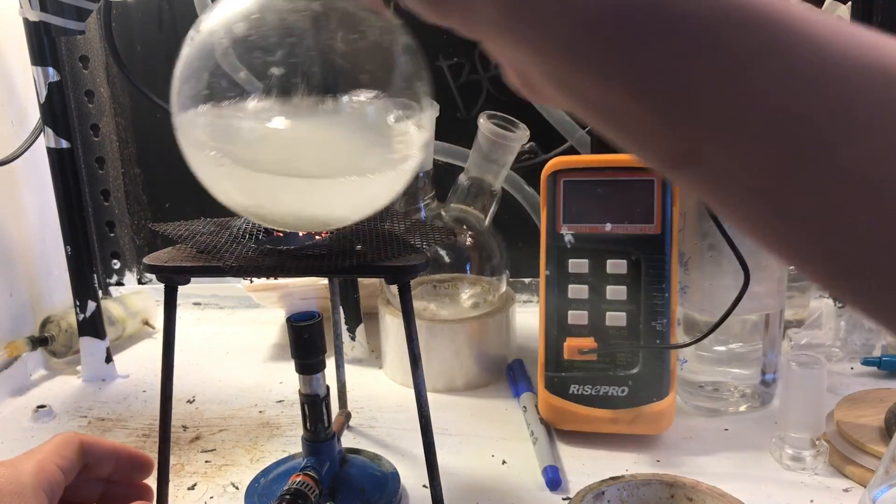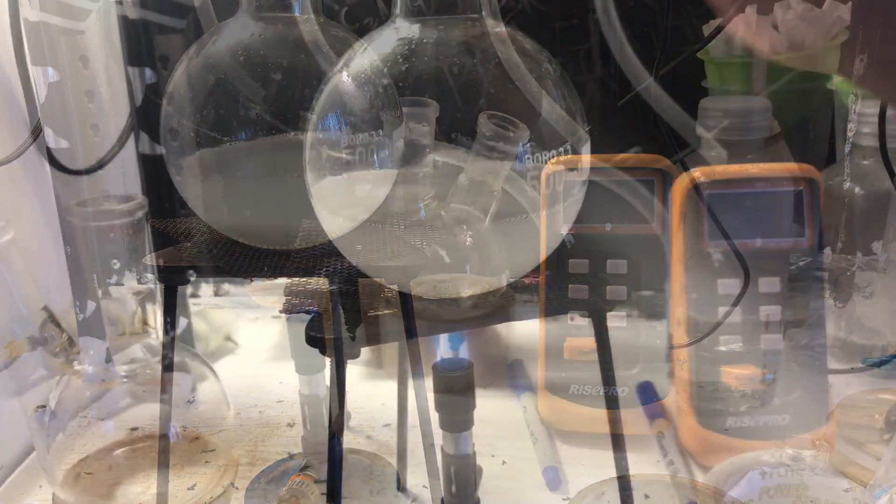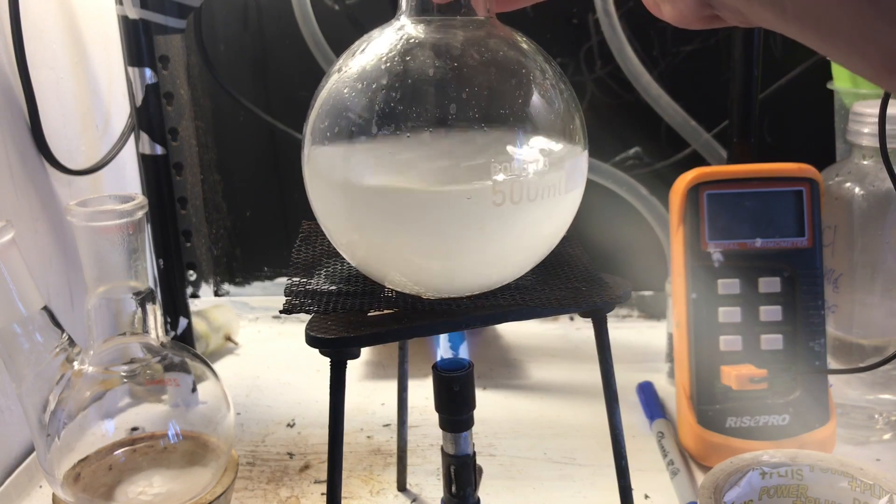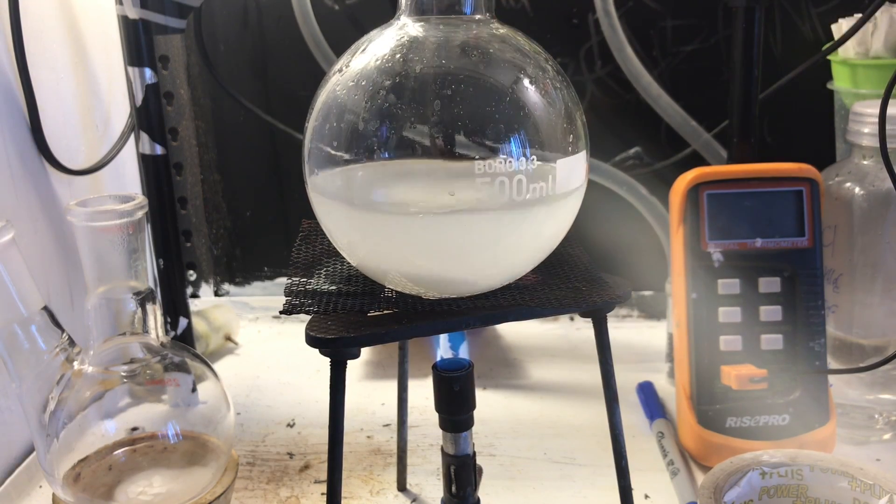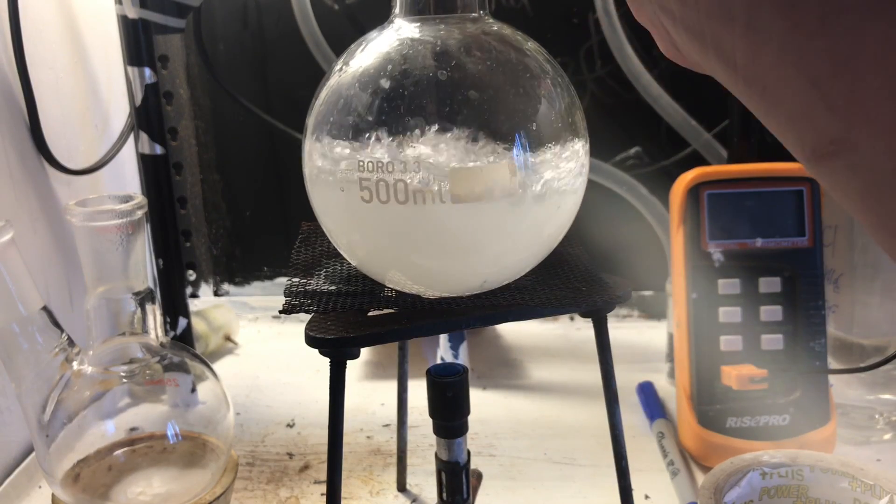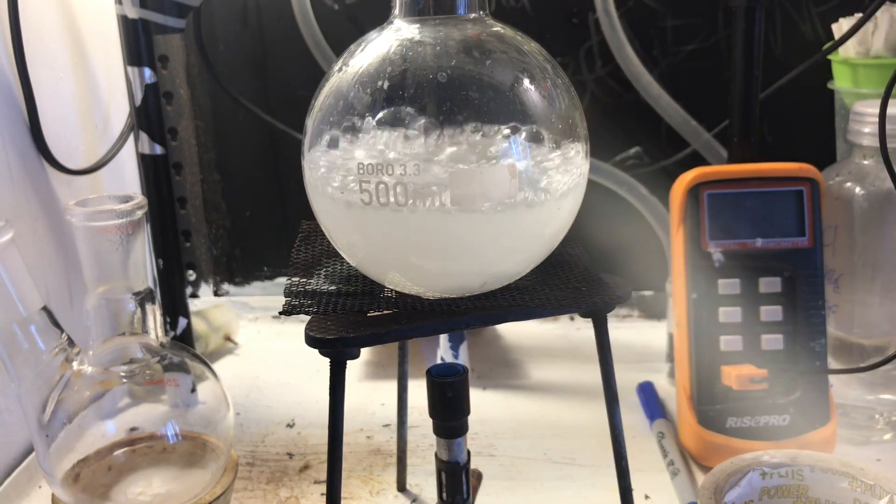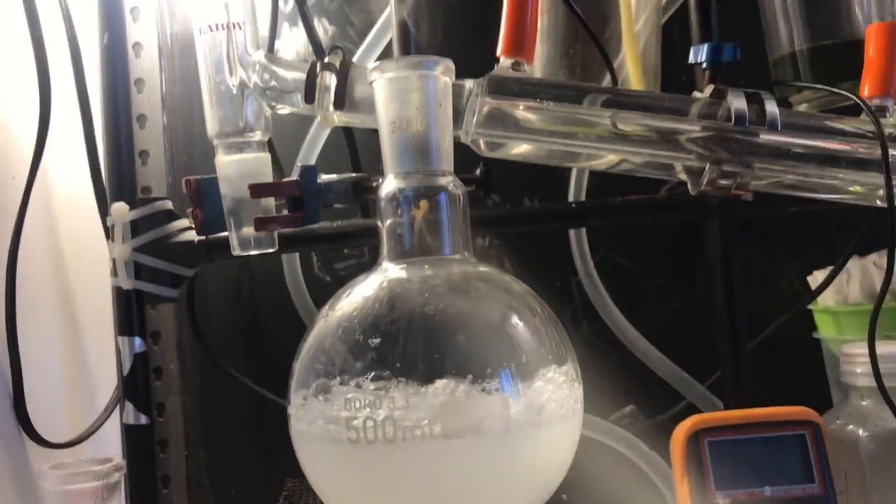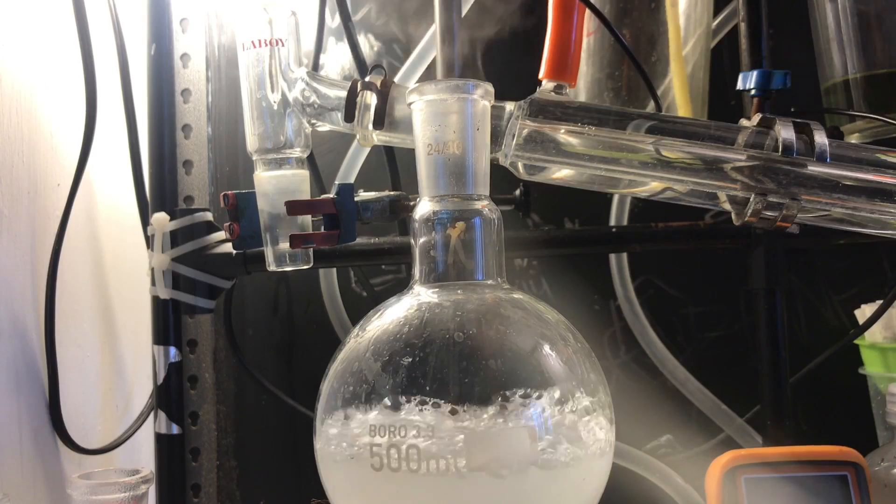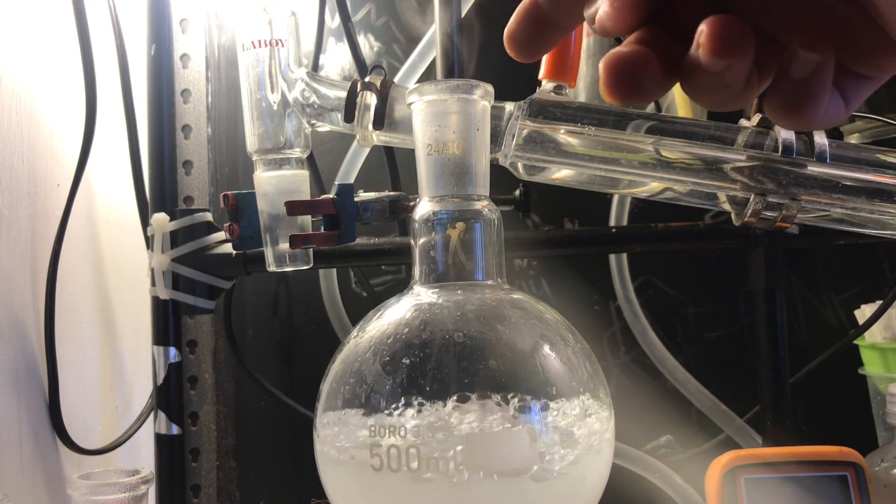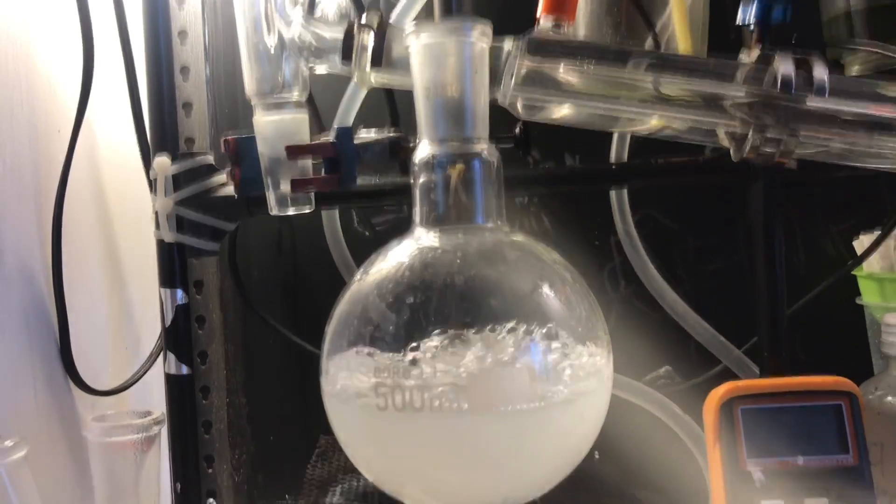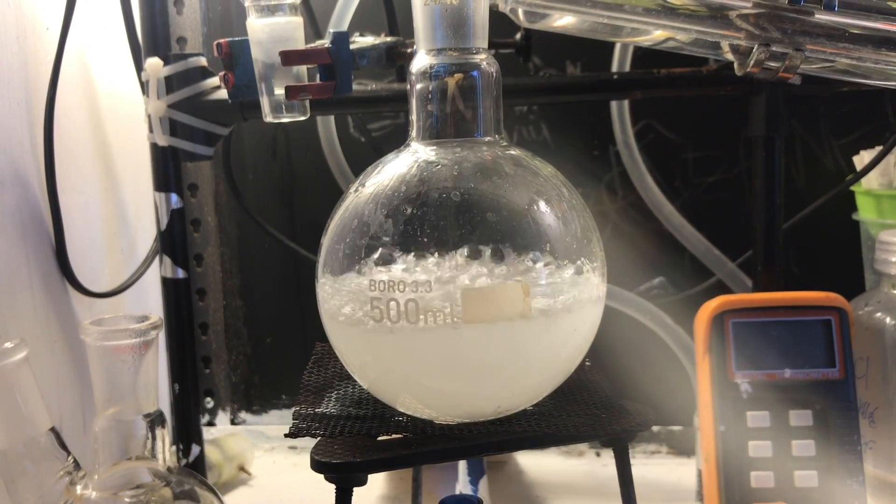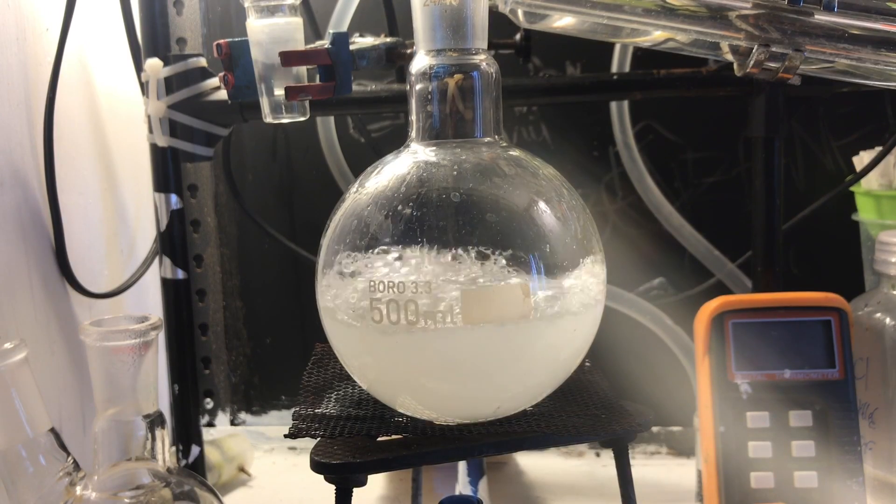You can see it's loosened up, so now just heat it to dissolve up the rest. If you did it right, it should be perfectly saturated at this temperature. However, mine wasn't. It didn't crystallize upon cooling, so I had to boil it further. This also does remove some HCl because the steam looks more different than proper steam. On camera I don't think you can see that very well, but it definitely stunk of HCl, so boil this in a well-ventilated area.